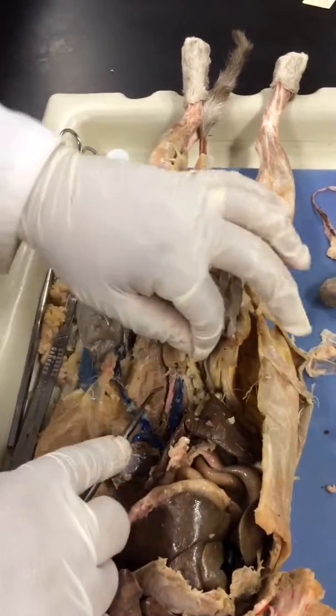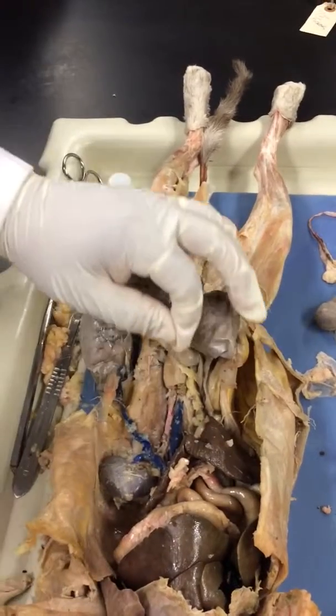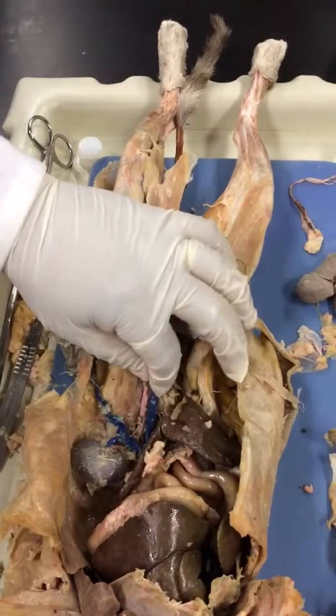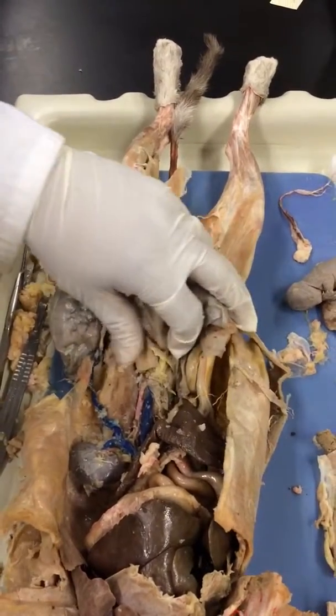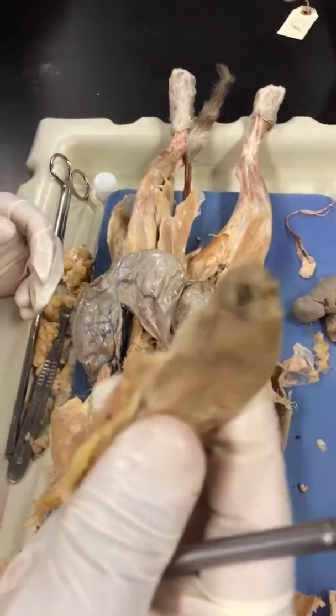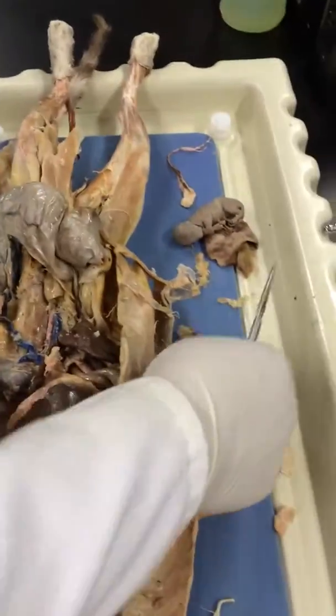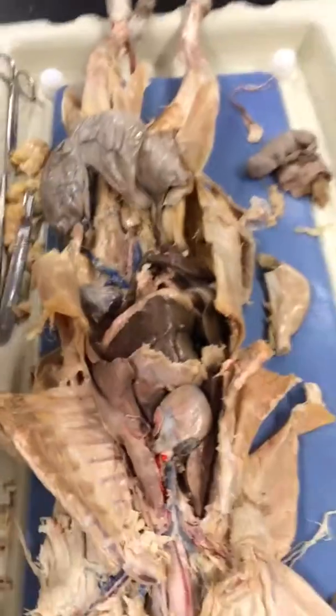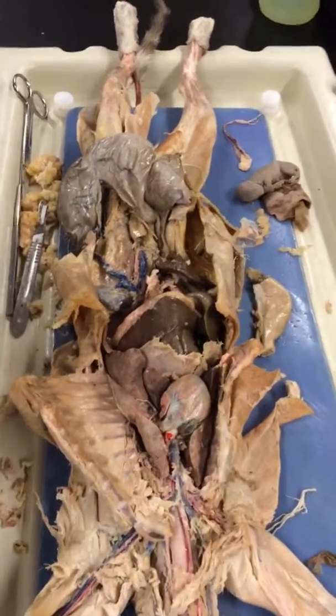This branch here that would have gone to the colon, what would that be? Inferior mesenteric, right? So you guys had an intact inferior mesenteric, and then you cut the colon. Yes. Terrible. You said to cut the colon for somebody. So we did too. I see.